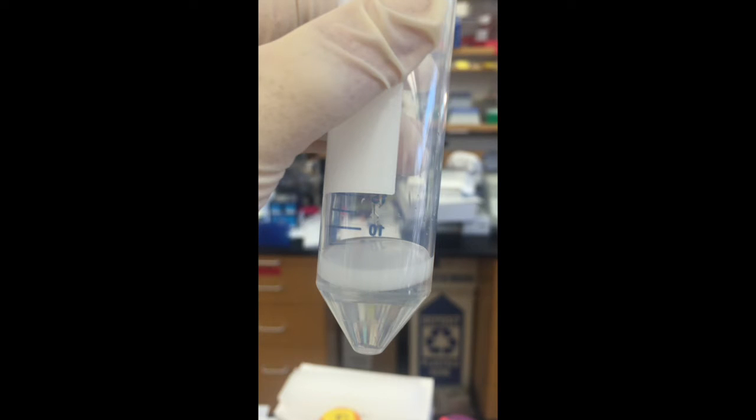So in this video I'm showing you the rock method where you take your falcon tube and just tip it slightly or rock it slightly over to the side and then bring it back up into a vertical position.